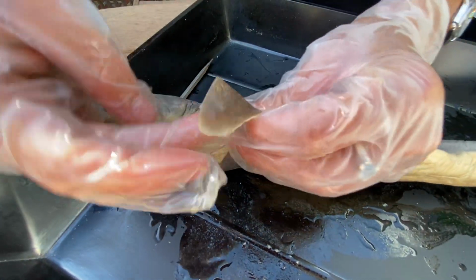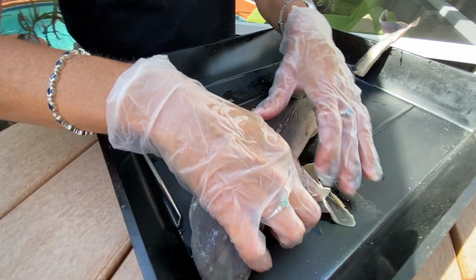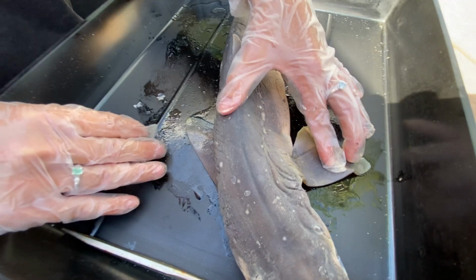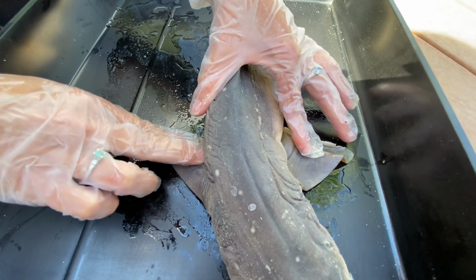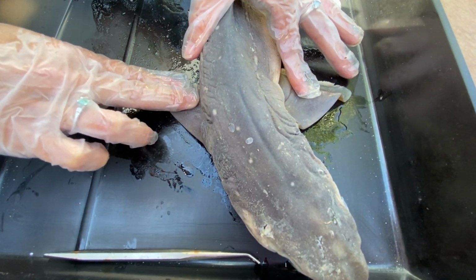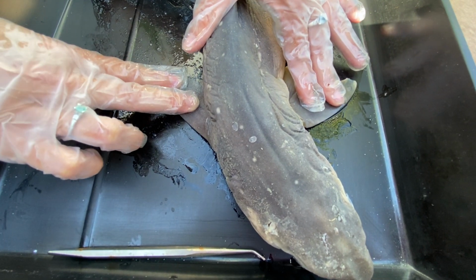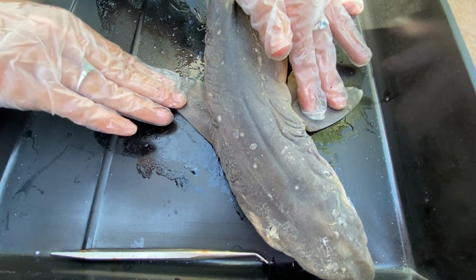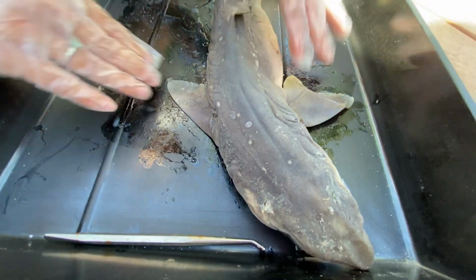Then you also have two pectoral fins. Okay, two pectoral fins are kind of folded because that was how they were in the bag. These are acting like airplane wings, okay? These are providing upward thrust, okay? So we had our caudal fin, because it was heterocercal, producing a downward thrust, and your pectoral fins for all sharks provide lift, or provide an upward thrust, okay? This is providing lift, but is also yet another stabilization and kind of helps with turning. So those are your main fins for the shark.